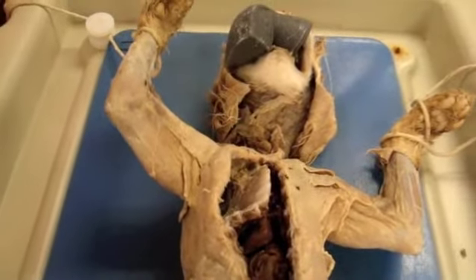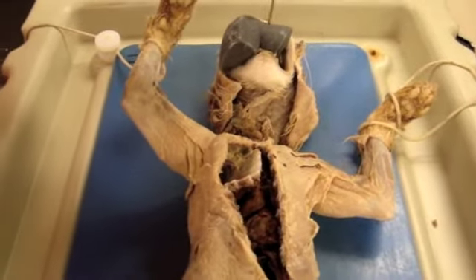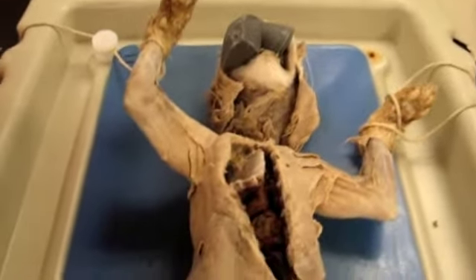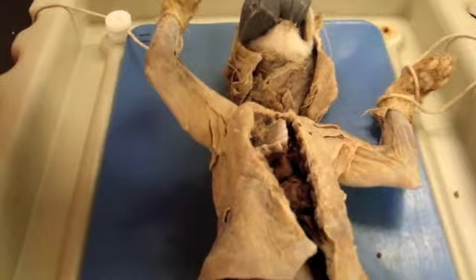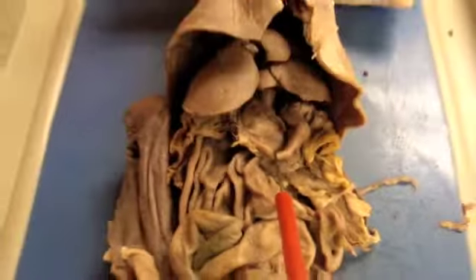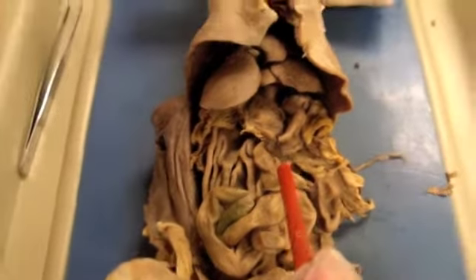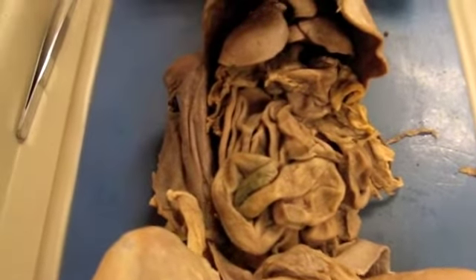So we're going to start telling you about the organs of the cat. When the cat eats food, it goes in its mouth where chemical digestion starts occurring with the secretion of salivary enzymes, and then it travels down the esophagus where it goes to the stomach, which is right there. And the stomach is a J-shaped muscle that is the site of storage and mechanical breakdown. So there are muscle contractions and digestion that occurs with proteins. And there's also minimal absorption of water, salts, as well as drugs in the stomach.